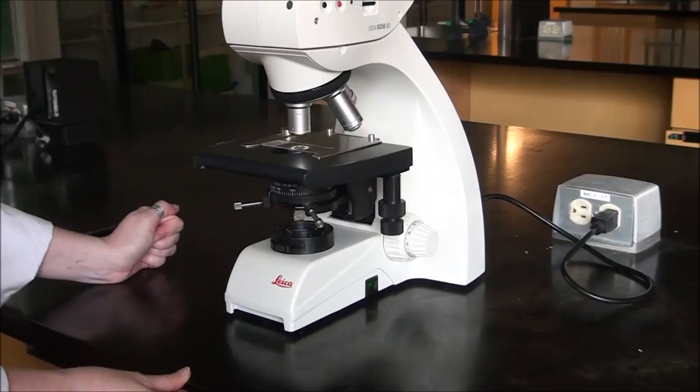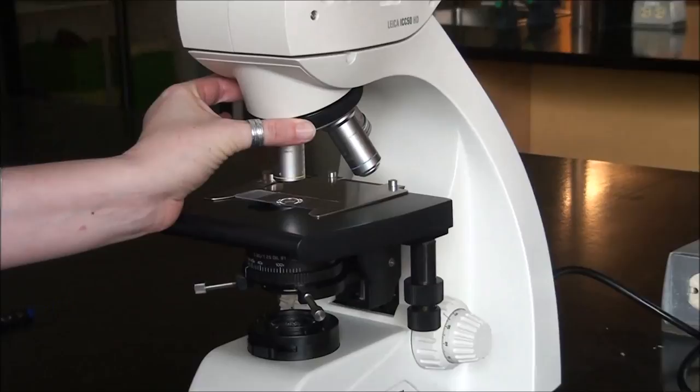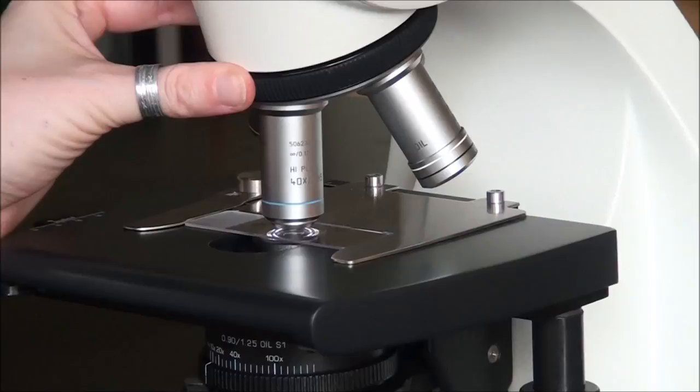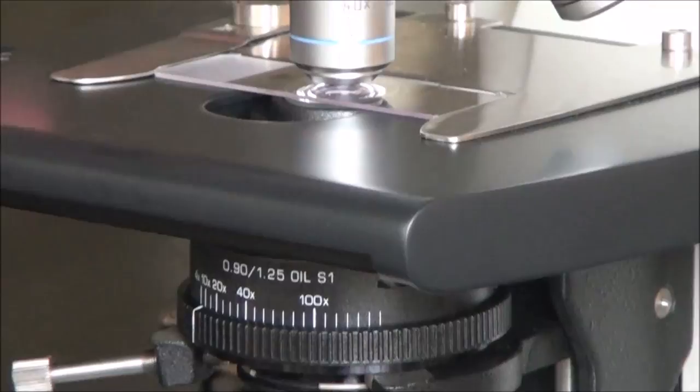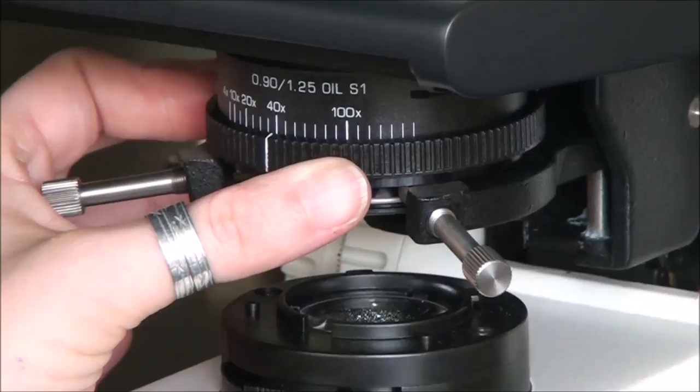Once your cells are in focus, we're ready to move to the next higher objective lens. Using the nice black grip on the turret, we're going to turn to the 40x objective lens, making sure it's locked into place nice and snug. The only other change we need to make is to go back to the aperture diaphragm and make sure that it is turned to 40 because we're using the 40x objective lens.